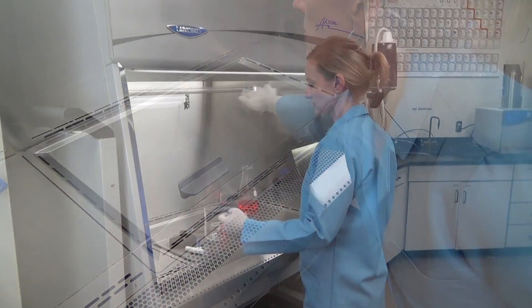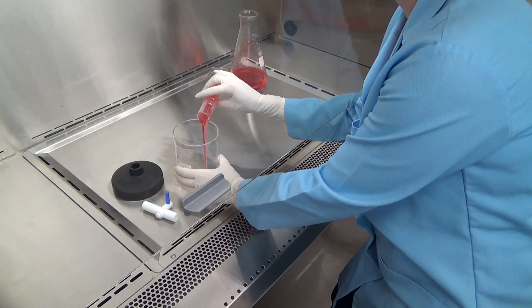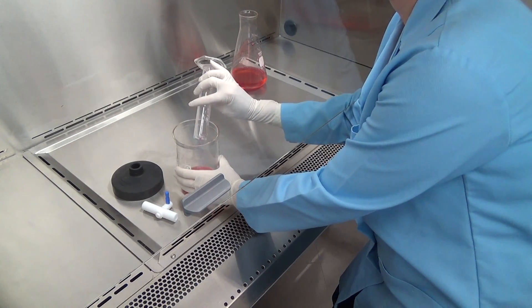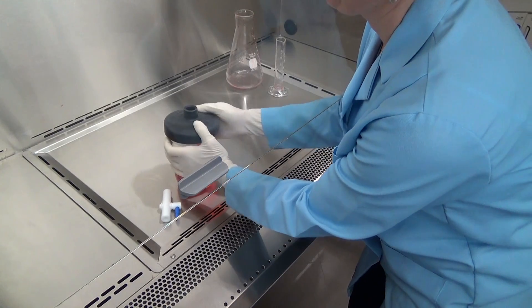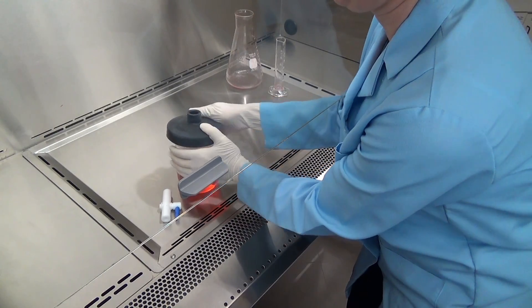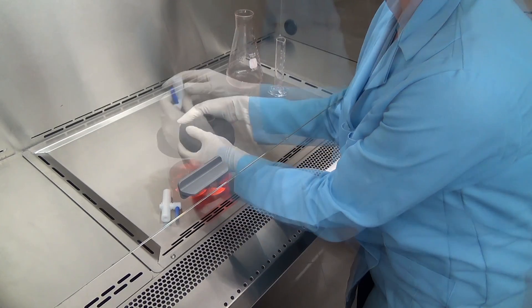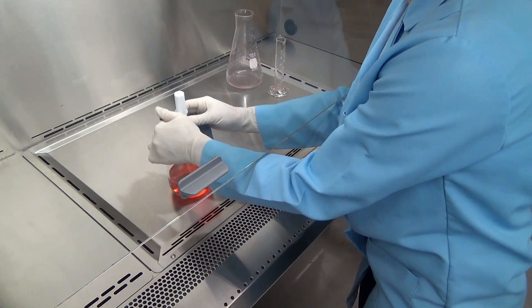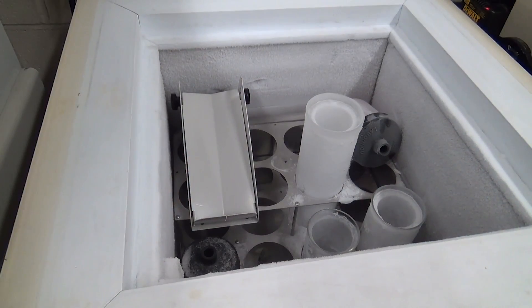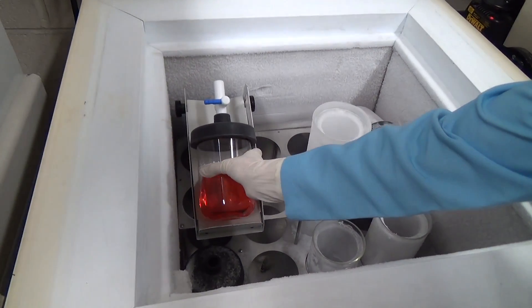In a sterile workspace, begin by loading your sterile samples into a 120 milliliter or larger fast freeze flask. Once the samples are loaded, place the silicon lid on top of the flask. Once secure, attach the aseptic adapter and make sure it's in the closed position.